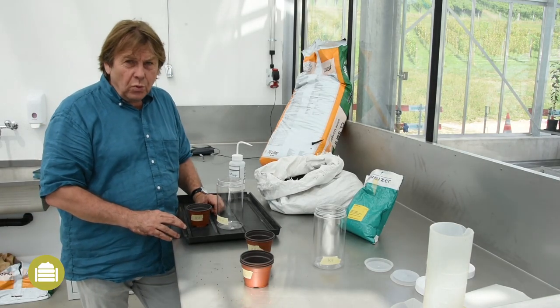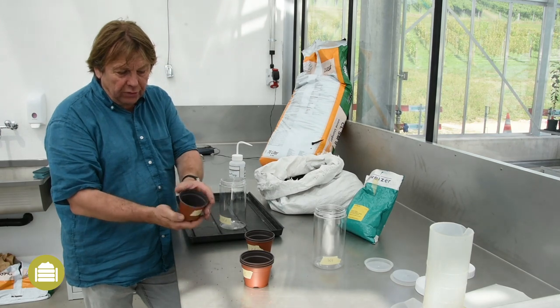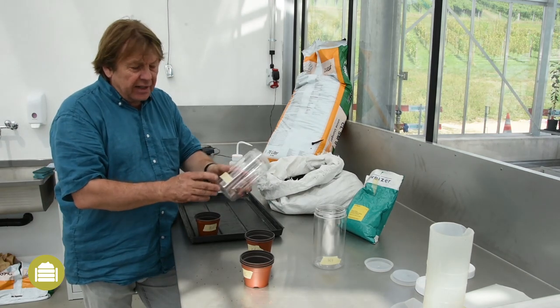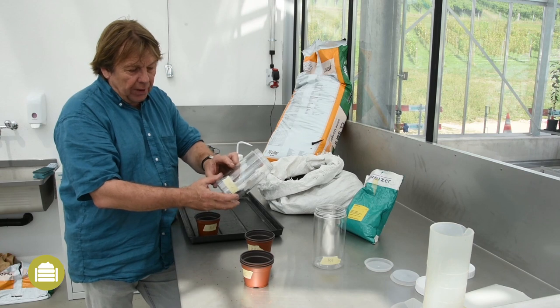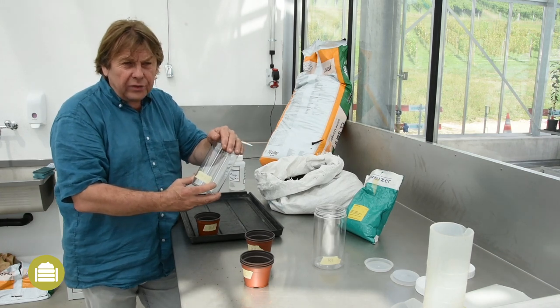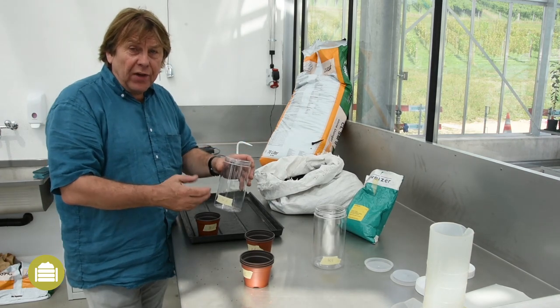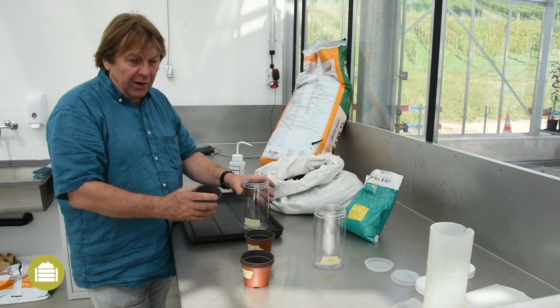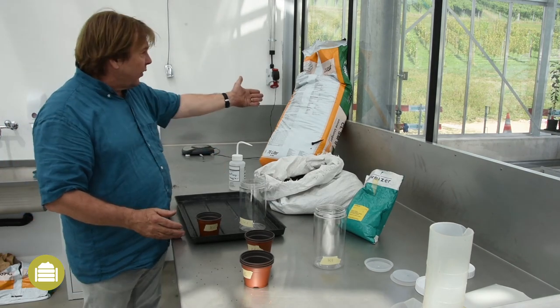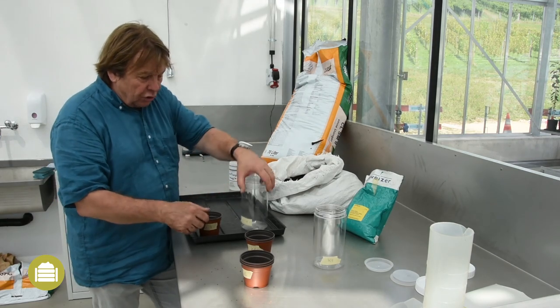For the biotest with plants I will use cress. I will make two different tests with cress. The first test is the open test — I use small plastic pots with nine centimeter diameter, and the cress will respond to the direct contact with the compost. The second test is the closed test — I use plastic jars filled half with compost, then hermetically sealed. Under this condition, the cress will not only react to the contact with the compost, but also to the gases generated by the compost, especially if it is not yet ripe. Therefore, the second test is highly sensitive, whereas the first one is less sensitive.